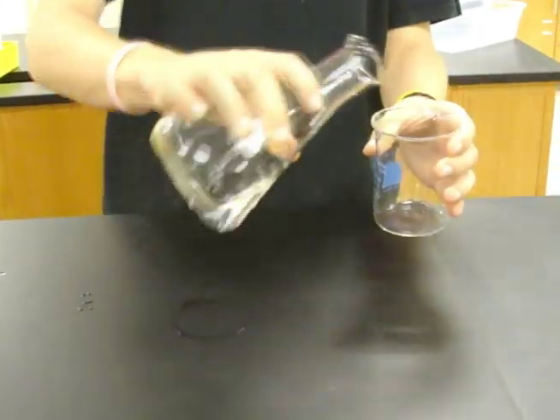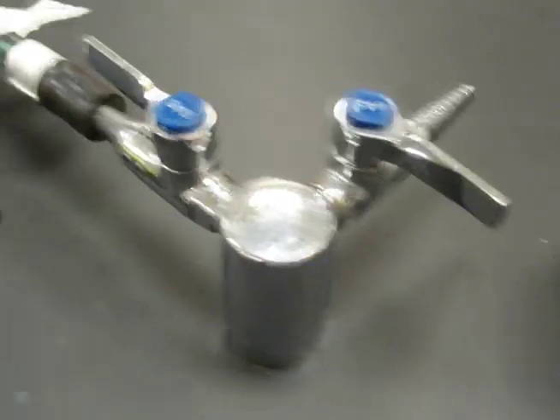If it has no label, throw it away, or else the lab will be in disarray. If you pour out too much, don't put it back in. Know how much you need before you begin. If your gas is on, make sure your burner is lit, and don't turn it on until you need it. There's no 5-second rule when you're in chem.